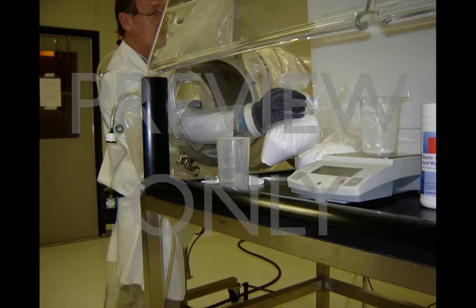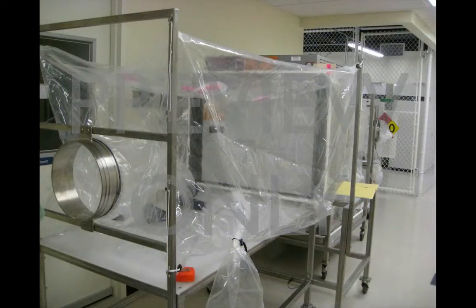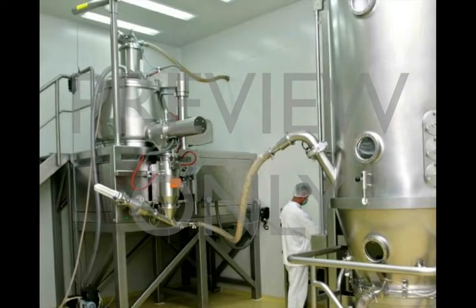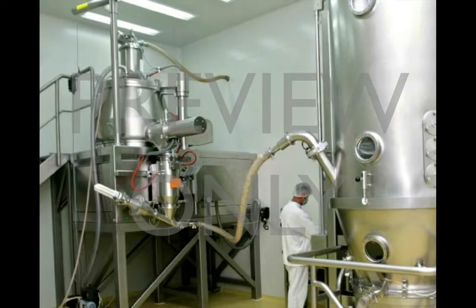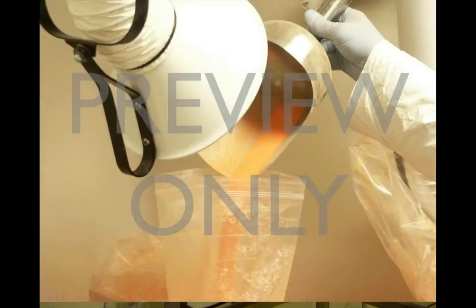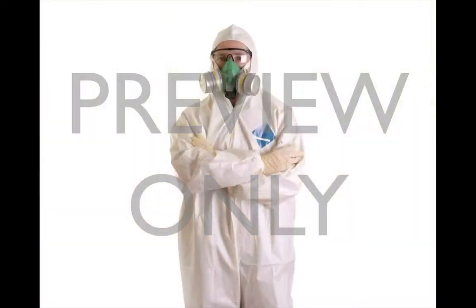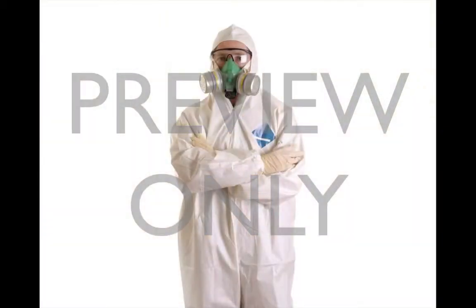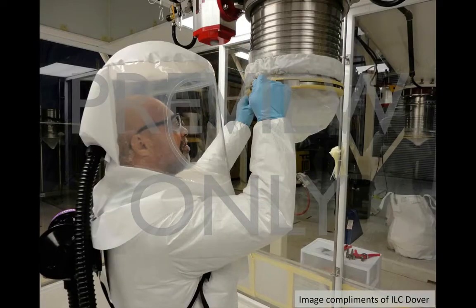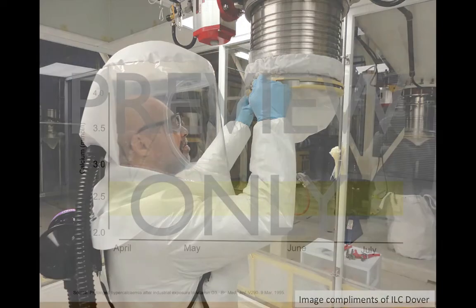Whether you work in a laboratory environment, at a contract manufacturing facility, or at a commercial manufacturing facility, this video is perfect for providing employees with an introduction to potent compound safety, or supplementing an existing training program.